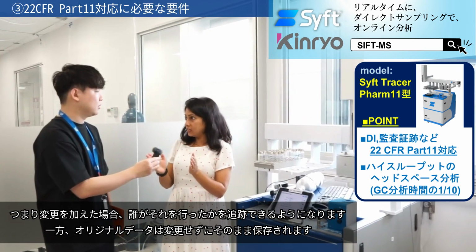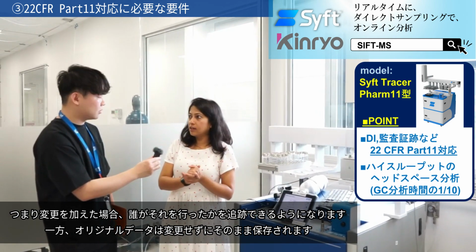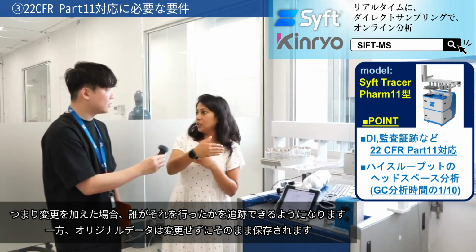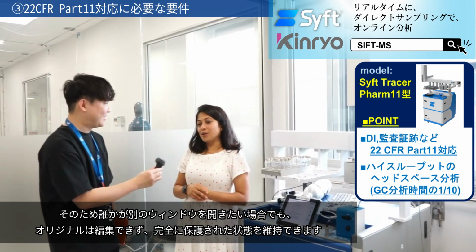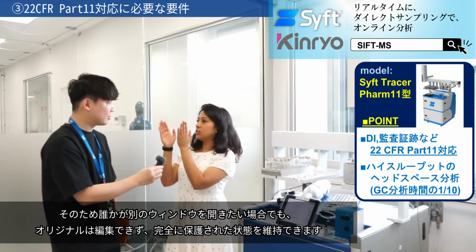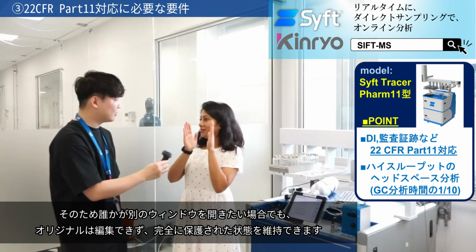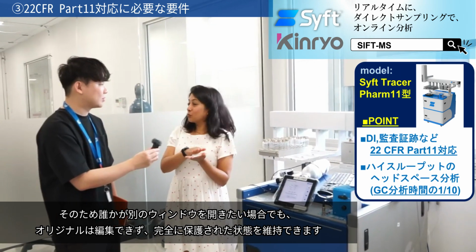So if they have made any changes, you would be able to track which user did that, at the same time keeping the original intact. That sounds perfect. So anybody wanting to take a different view, they can, but the original remains uneditable and foolproof.